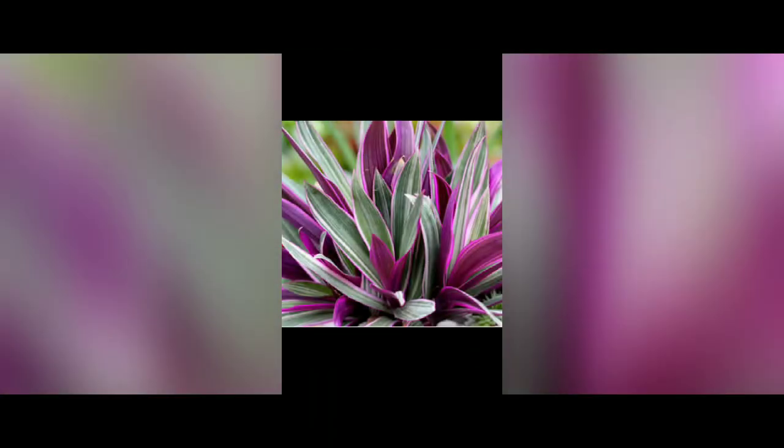So we have to learn this plasmolysis. Here we are showing plasmolysis in a plant cell, that is an onion cell. So we are doing the activity of plasmolysis of an onion cell. For understanding plasmolysis, we normally use the Rhoeo leaf. You can see the image over here, dear students. This is an image of Rhoeo. Why is Rhoeo required for understanding plasmolysis better? Because you can see that Rhoeo is colored.